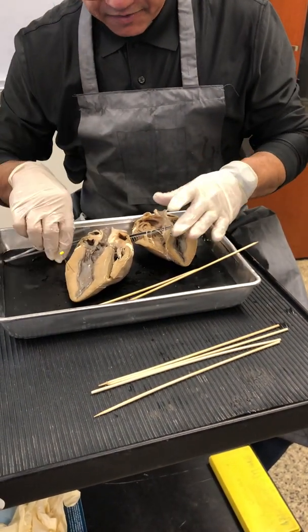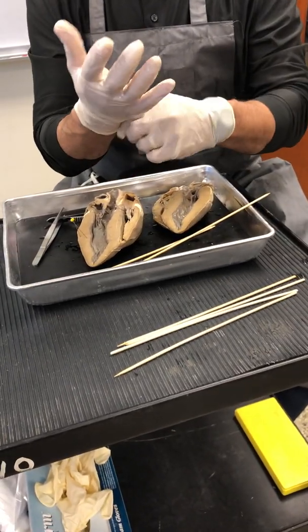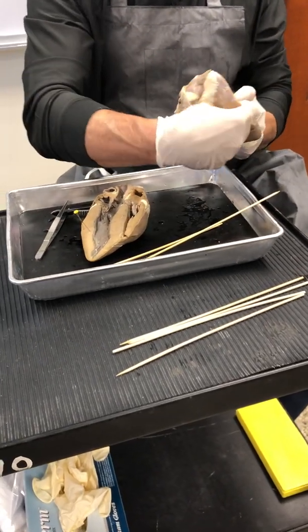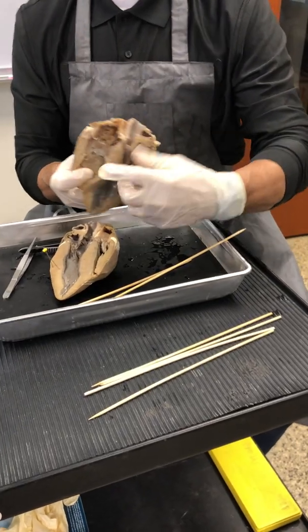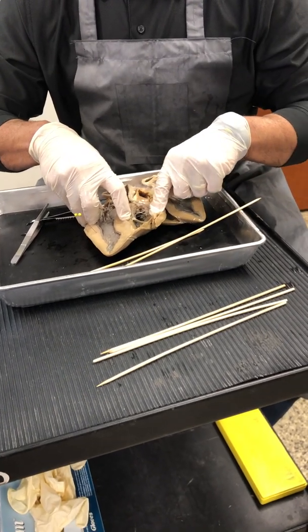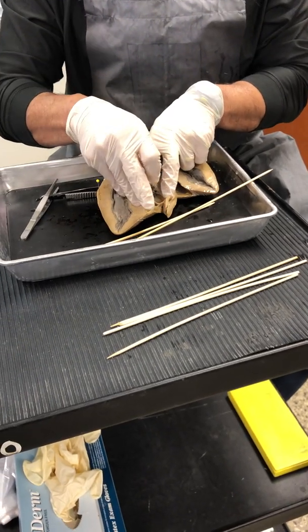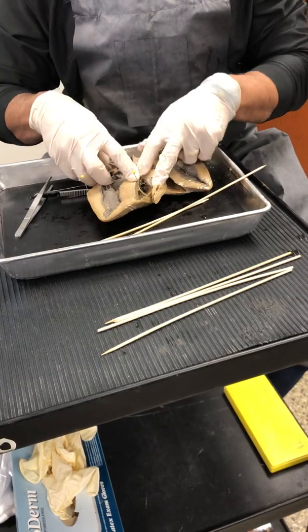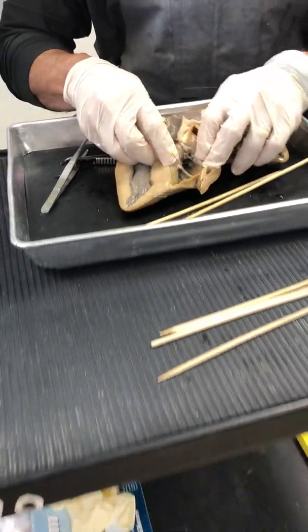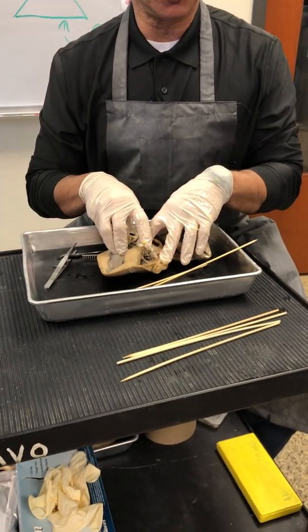All right? Now the right ventricle, the artery that leaves the right ventricle is the pulmonary artery. So there's nothing there. You can see it dead ends right there. And you stick your finger in there and you feel nothing there, which means that the pulmonary artery has to be there. Now, when you pull open the right ventricle of the deer heart, folks, you're going to see a nice trabeculae carneae right there. So that muscle that runs left to right in the right ventricle is the trabeculae carneae.